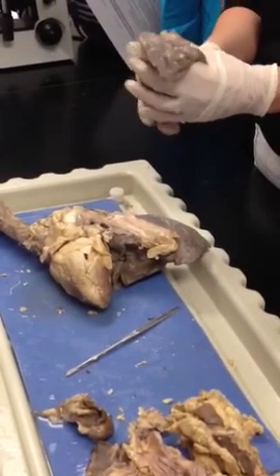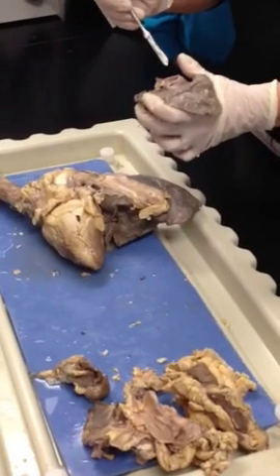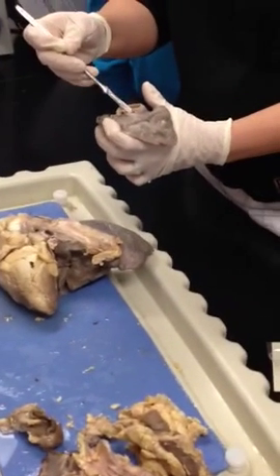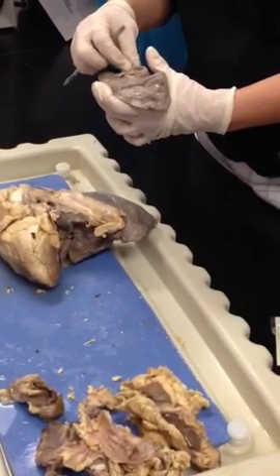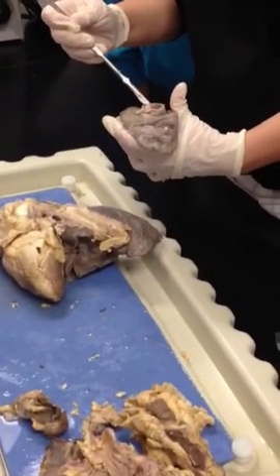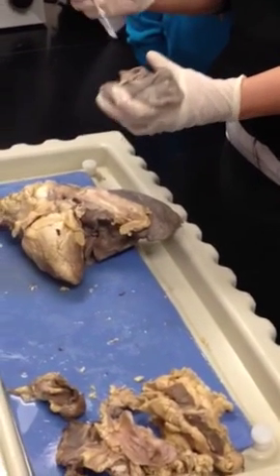Okay? It's flip-flopped. But still, when you're trying to identify, the artery still has a much thicker tunica media. So it's going to be a much thicker vessel. The vein's going to be super flimsy. It's going to have a very flimsy wall. Okay? So you need to be able to look at these up close. You guys aren't going to be able to tell if I'm just recording. I'm just letting you know right now, okay?